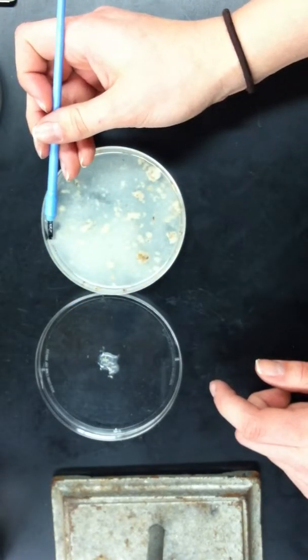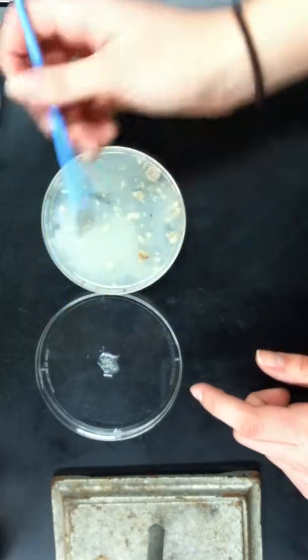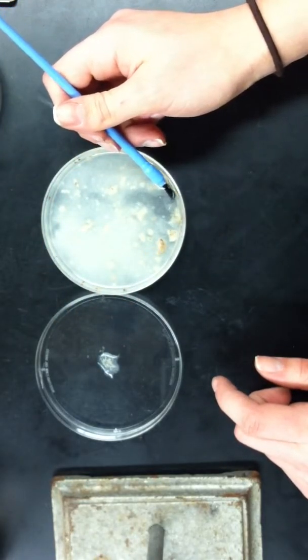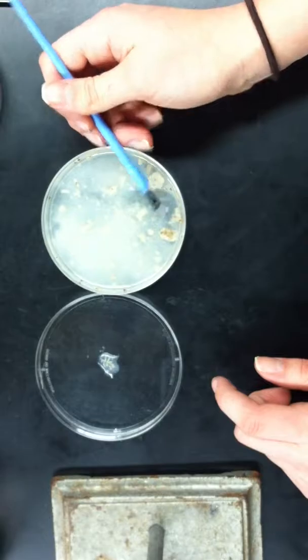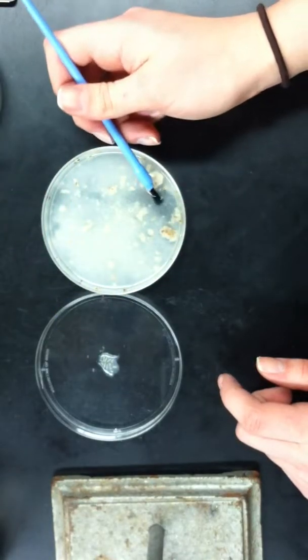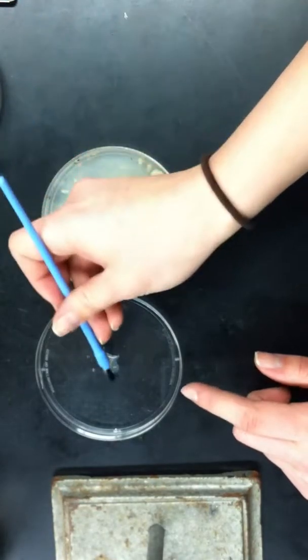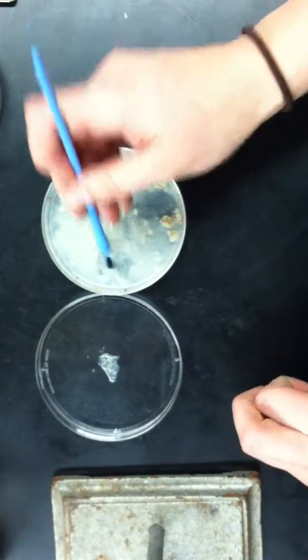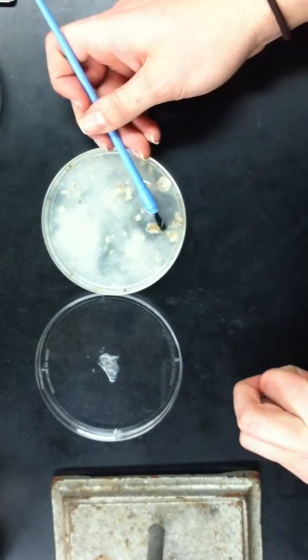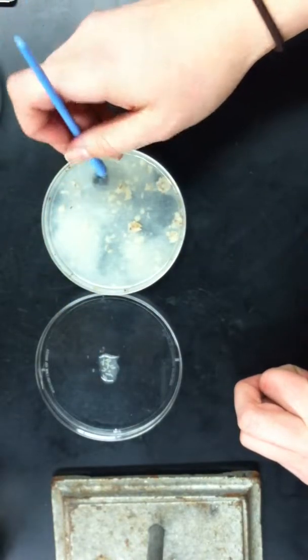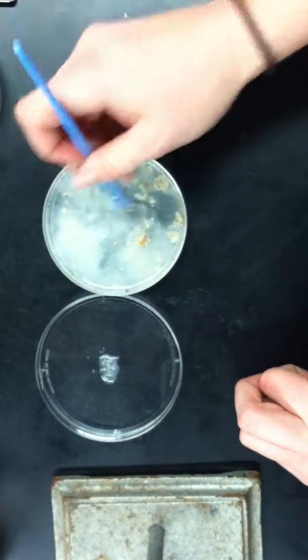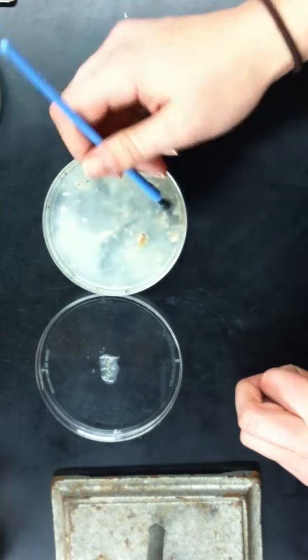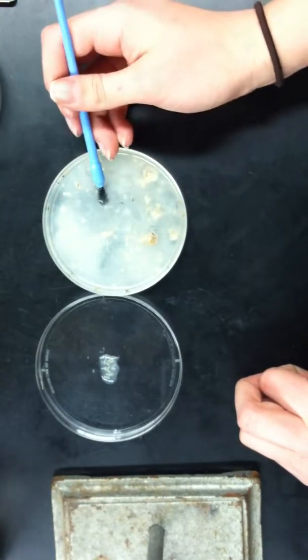So just as many as you think you'll need for the trial. Again, probably 15 to 30 average. Some vials will have more larvae than others. That's why it's important to look at the tunneling in the fecund culture, because the more tunneling you see, the more larvae that are probably present. And if there's more pupa, or just pupa. If there are more pupa on the sides, that means that it's been going for a while, and there's most definitely going to be larvae in there.